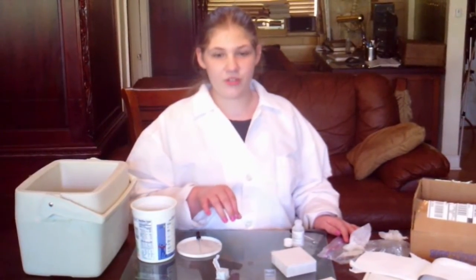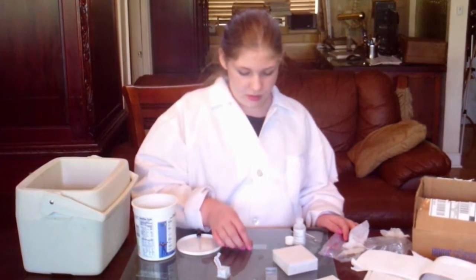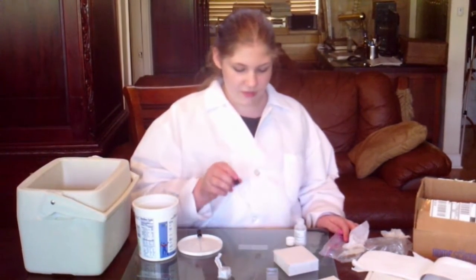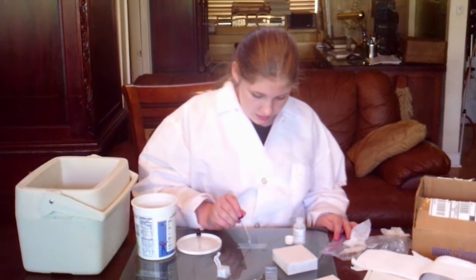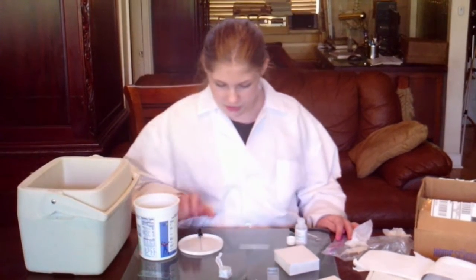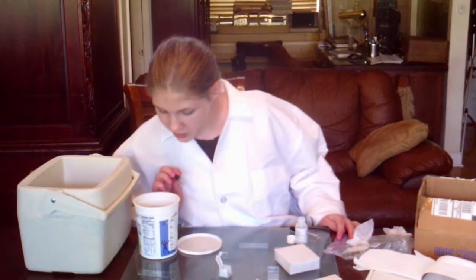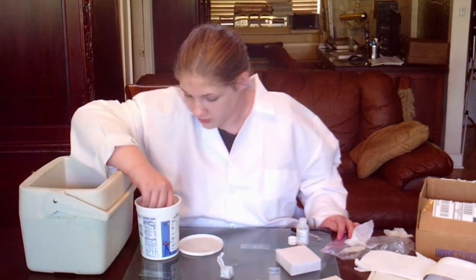To view microorganisms, you take a clean slide, the slightest drop of methyl cellulose to slow down the microorganisms, and then you take some of the sample, which in this case is pond scum.